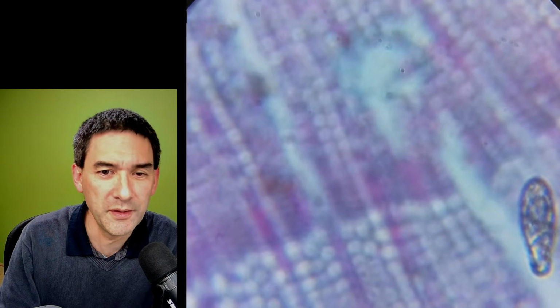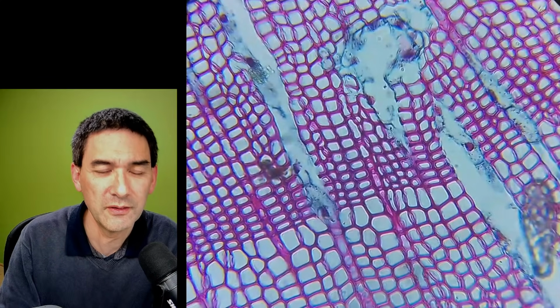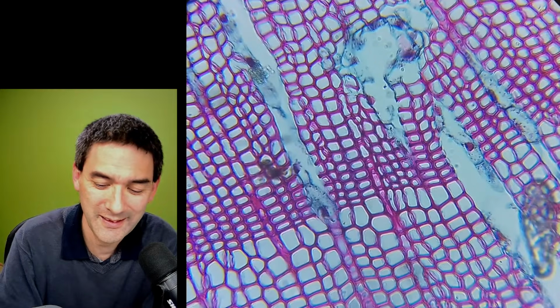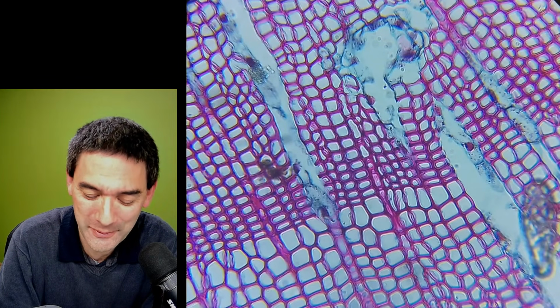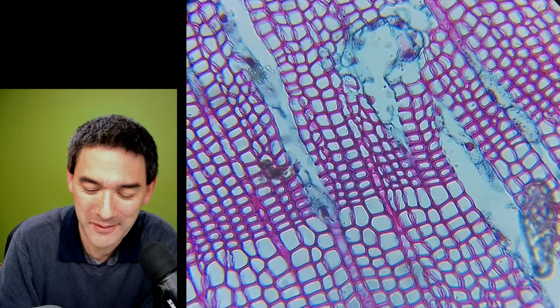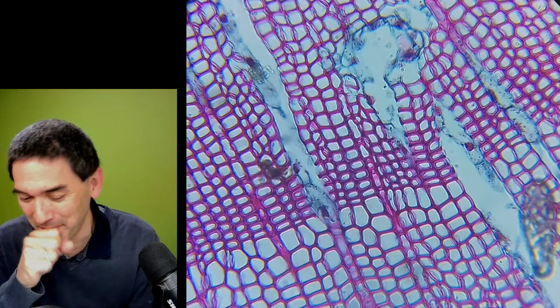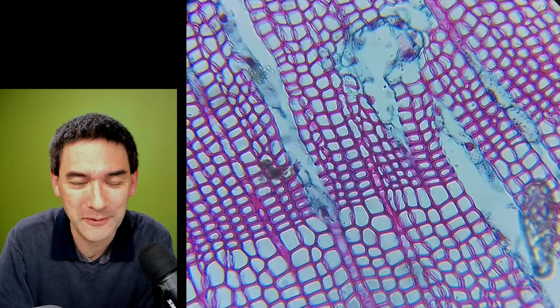This paramecium thing on the side. Refocus. Yeah, and here we go. I think I'm quite happy. Honestly, this is a really cheap microscope. Yeah, it allows you to have a little bit of fun with microscopes and so on. You don't need a lot, huh?